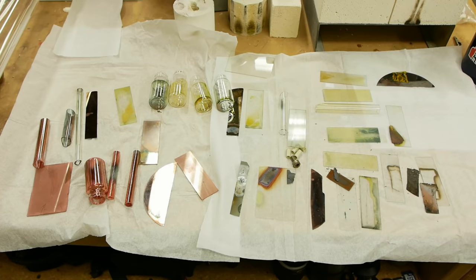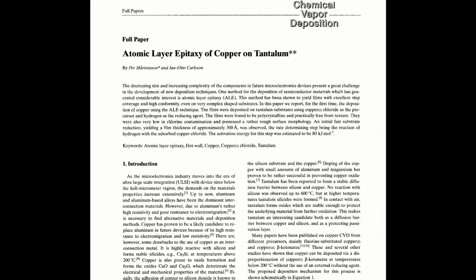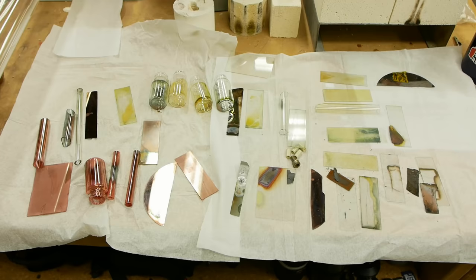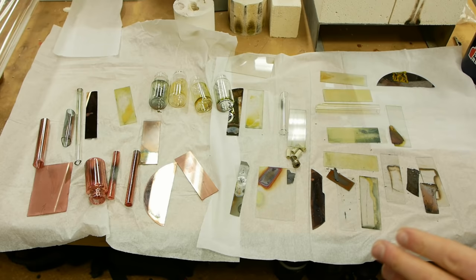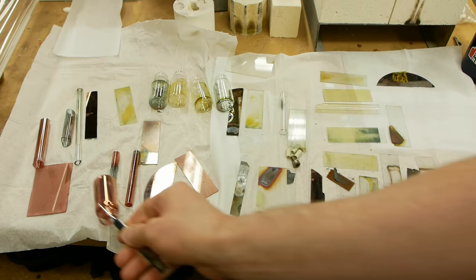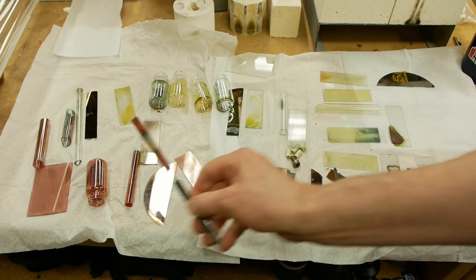Part of the reason that I make these YouTube videos is to experience the highs and lows of taking an academic reference and trying to put it into practice. So this is not even a fifth of the failed attempts that I've got. And after working on this thing for a few weeks on and off, we're over here. And I'm really happy with this. I think this looks really good. It's by far the best one I've made, which is convenient because I was going to make this video anyway this morning, regardless of what came out of the kiln. So you get to experience the happiness, the highs that this thing's actually working.